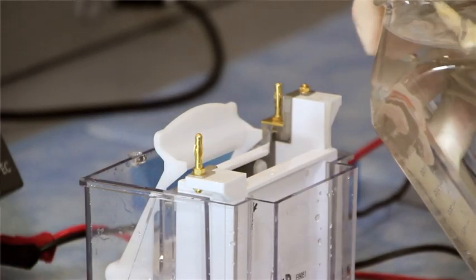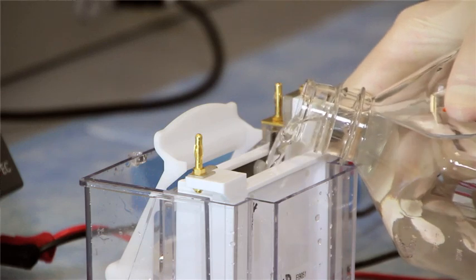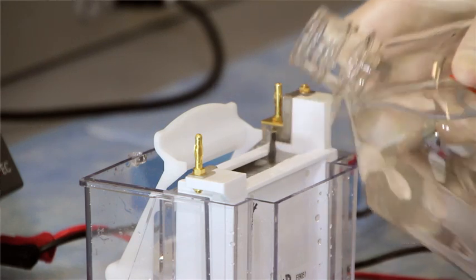And now we're going to take some of our transfer buffer and fill up the inner chamber with transfer buffer up to the top.